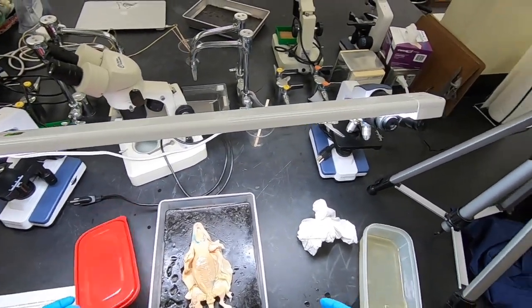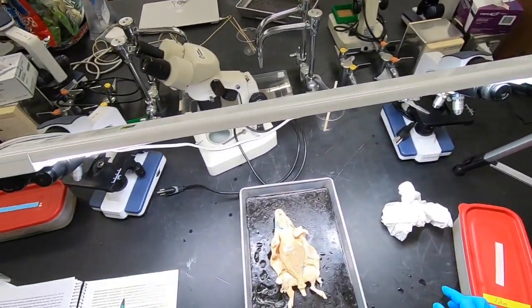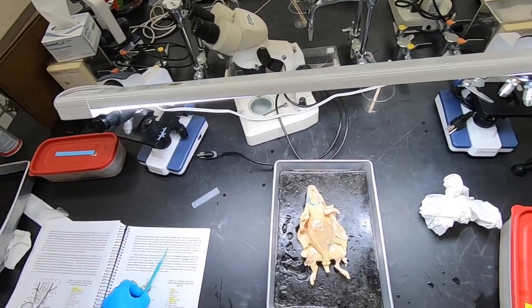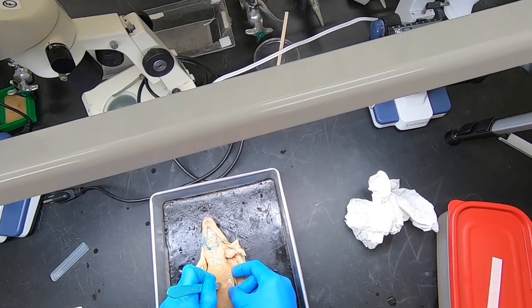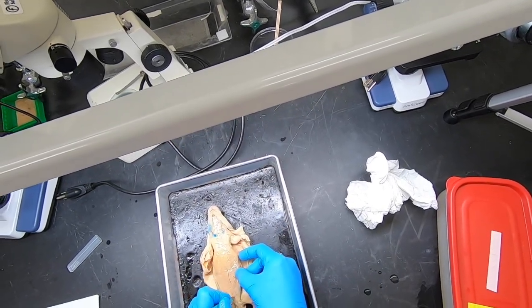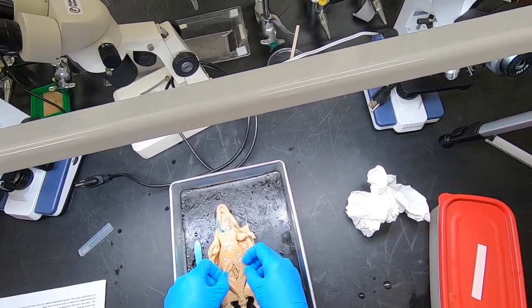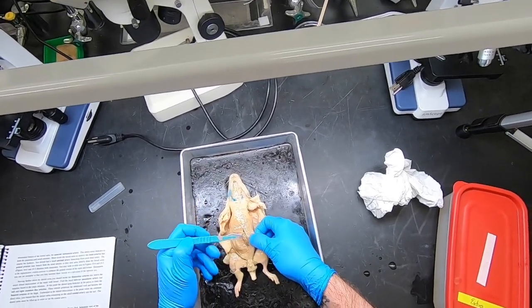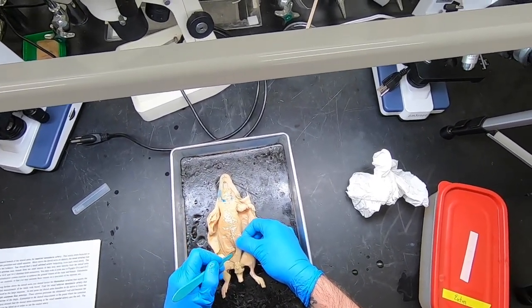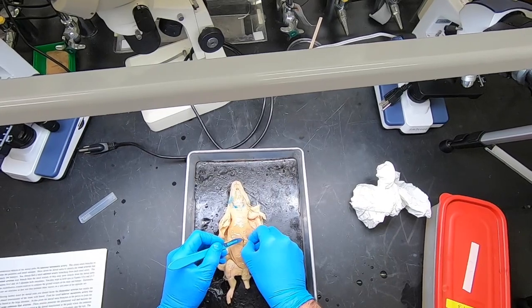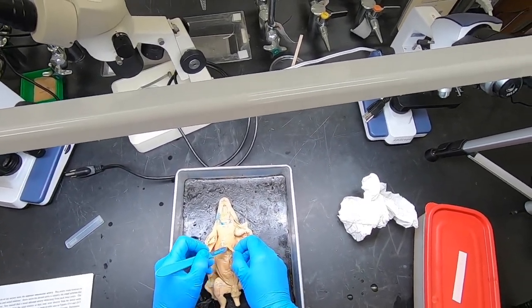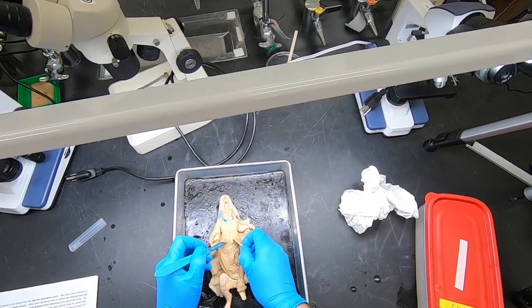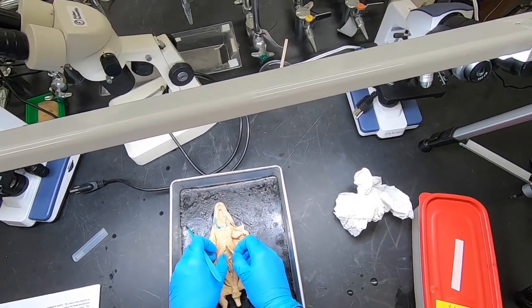Okay, so now we're going to take a look at the insides of this lady rat here, down through the abdominal wall to the base of the diaphragm. I don't want to get into that just yet.